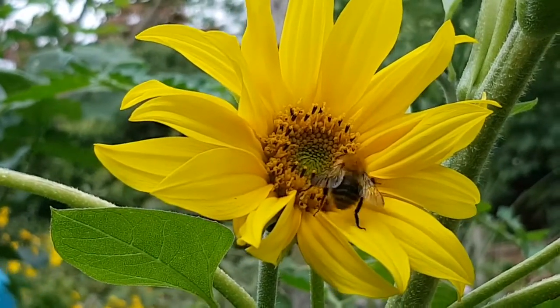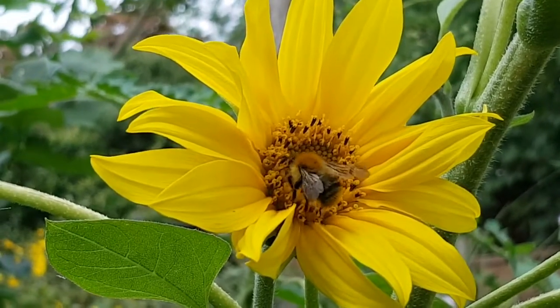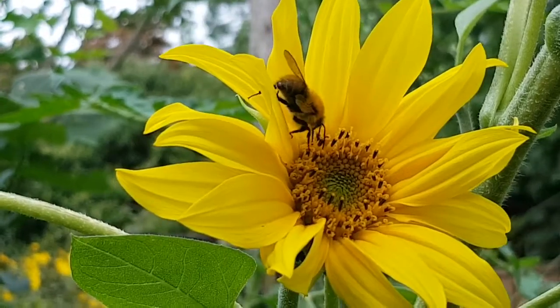Awesome. Okay, now I've got my microscope set up. I just need to sort of calibrate the lenses for focusing on things for my eyes. Let's go and collect some pollen from a sunflower. Dad's got some sunflowers in his garden. I'll just see if he's got any sunflowers I can steal. So I'm going to take this sunflower head, snip it back down and put it into a plastic bag.